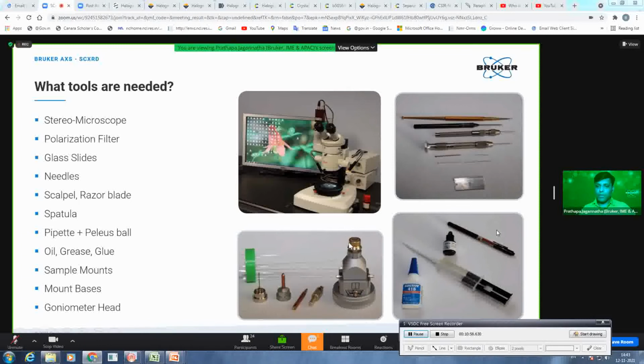To avoid this, have this strong magnetic base, and then you just play with these different kinds of mounts. So there are some steel pins and there are copper pins. Copper pin has its own advantage because it's a better thermal conductor, so formation of ice will be minimum here. And then you get some capillaries and loops, which I will explain later.